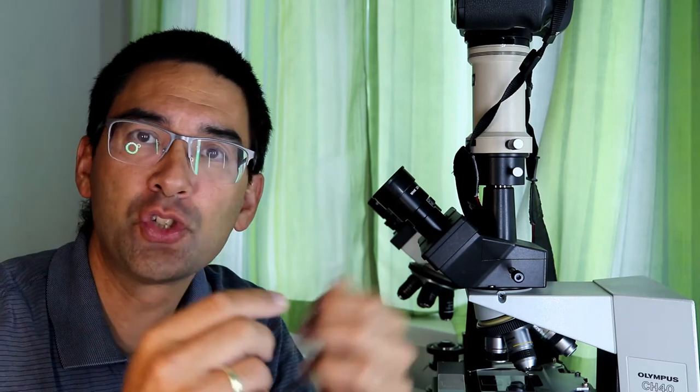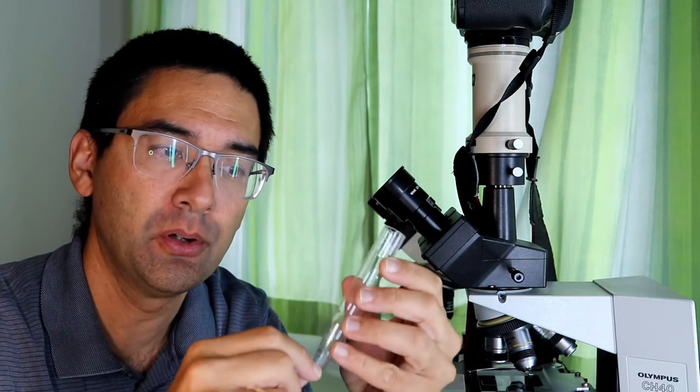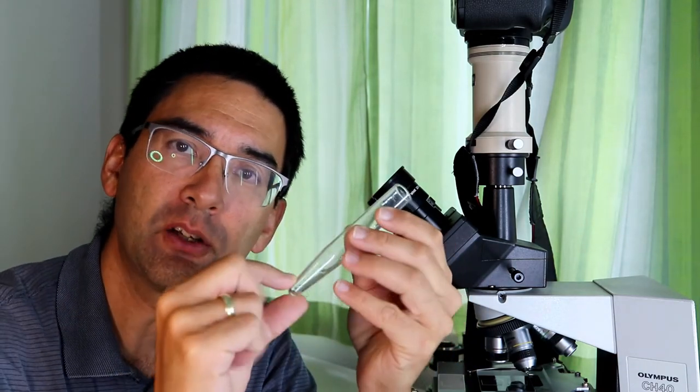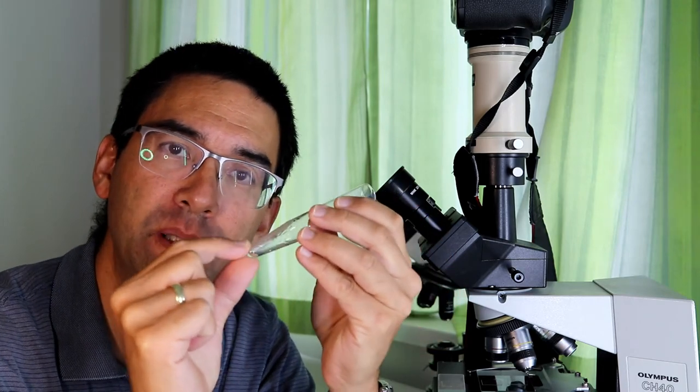Well, how important is centrifuging now? Can you not just simply do without it? And I think not because centrifuging collects, concentrates all of the pollen here at the tip.